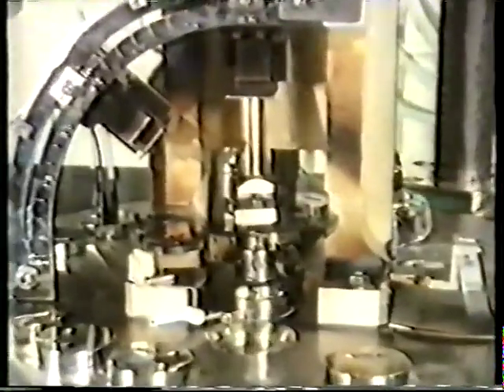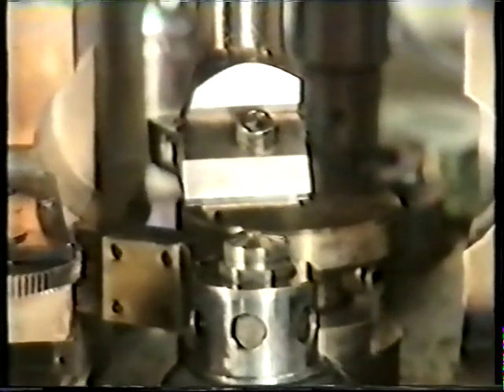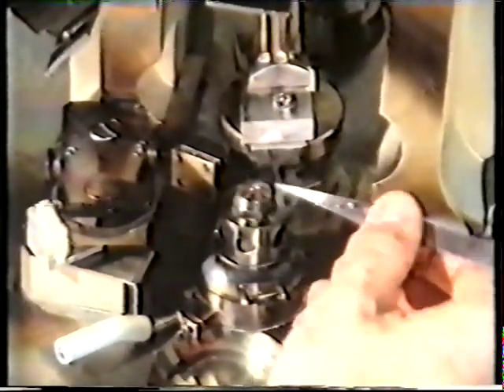Inside the freeze etch machine, there's a specimen stage, and poised just behind it, the knife, which is used to cut the specimen, and focused on the specimen, just above it, are 2 electron bombardment guns used to cast a replica of the specimen after it's been fractured.